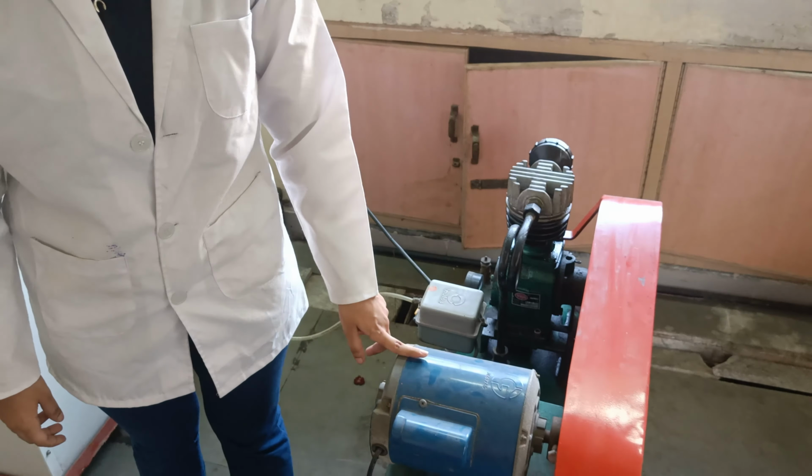This is an air compressor. During the reaction, the reactants go into the reactor from the bottom. For helping the reactants go against gravity, this air compressor is used. After that, we have the actual reactor in which the reaction takes place. This is a long, narrow, hollow cylindrical tube filled with packing materials known as Raschig rings. These rings are the packing material used for helping better contact between the reactants. These rings also help break down the big bubbles happening in the reactor.